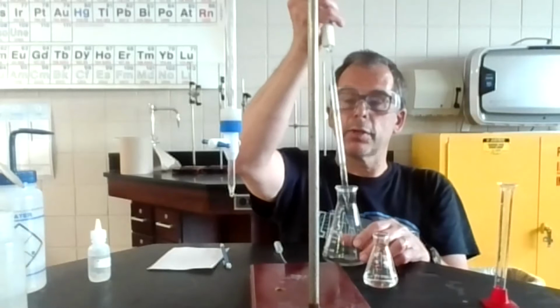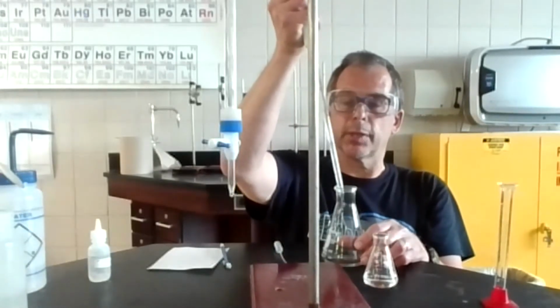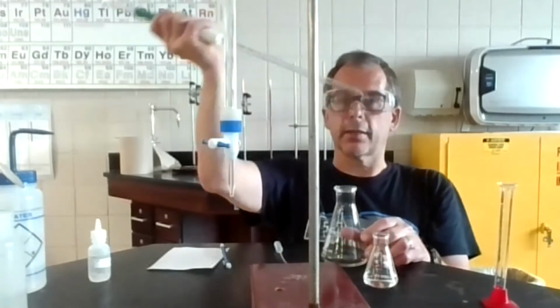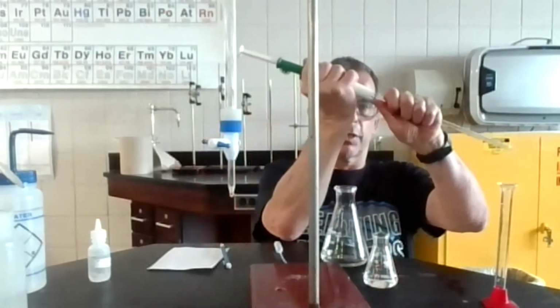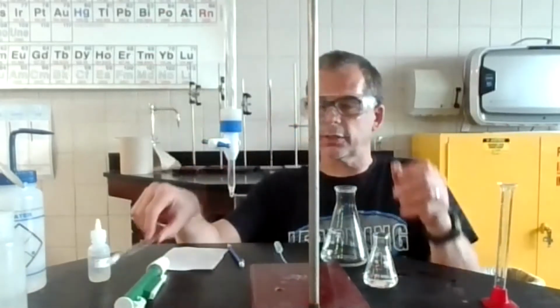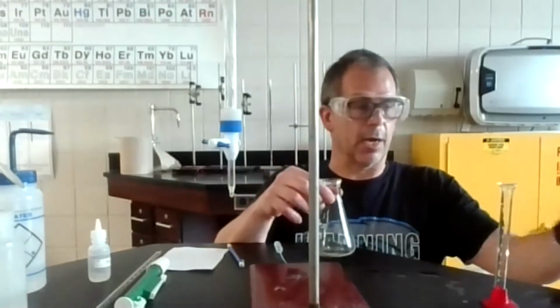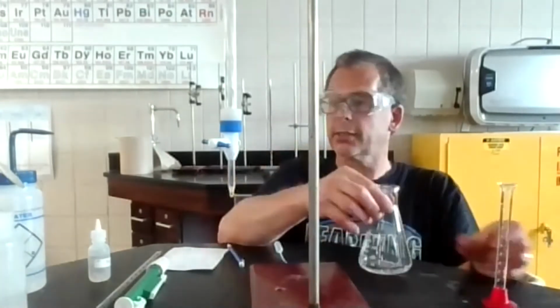And then what I'm going to do is tap the glass, get that last bubble out, little pipetting thing. And then I have this piece. So I just use this thing as a draw, pulled up on it. I can show you that if you have questions when you're doing that in lab. Okay, so the next thing is I got my 10 milliliters of this unknown acid in here.